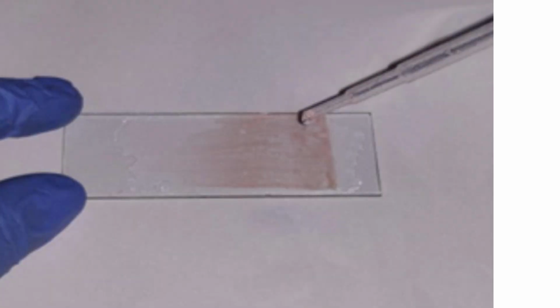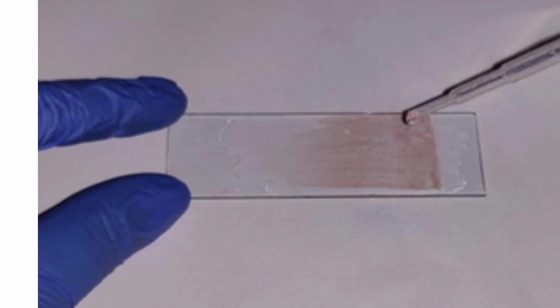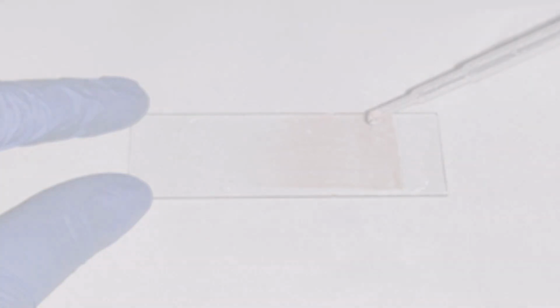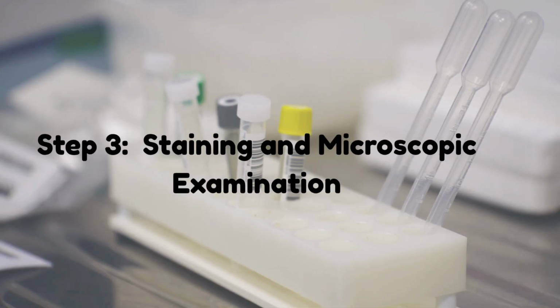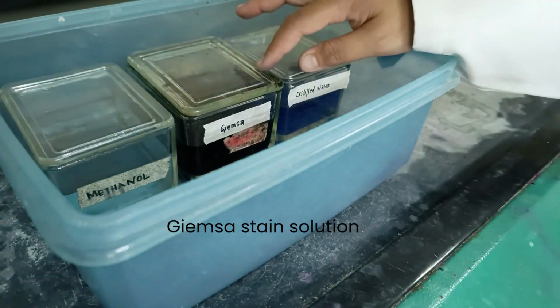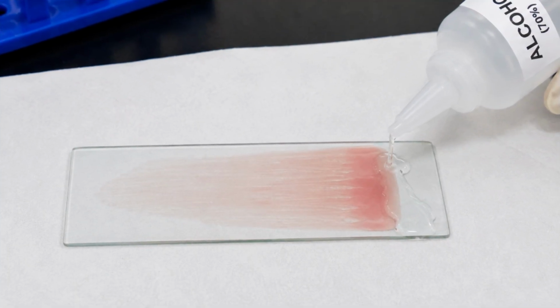Next, allow the smear to air dry completely, as this helps preserve the normal morphology of the blood cells and ensures optimal staining quality for microscopic examination. Step 3. Staining and microscopic examination. Firstly, prepare Giemsa stain solution according to the manufacturer's instructions. Place the blood smear, which has been dried and fixed with methanol for 2 minutes, on a staining rack or in a staining vessel. This preparation preserves cell morphology and provides an ideal surface for the subsequent staining procedure.